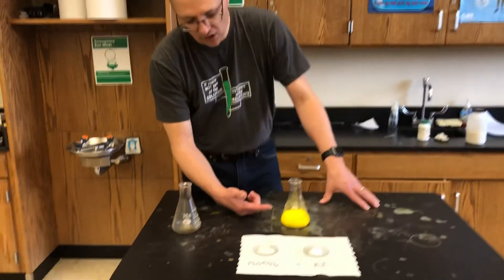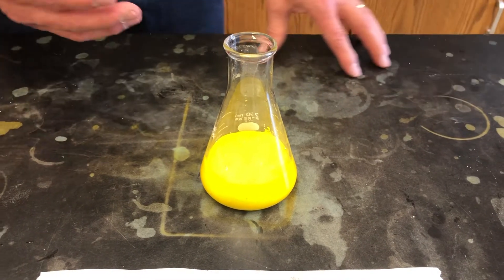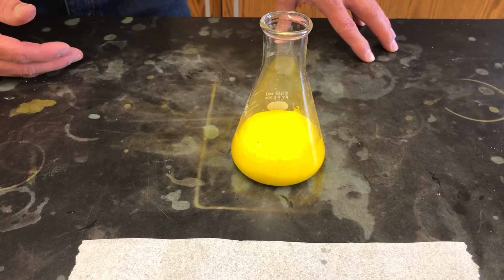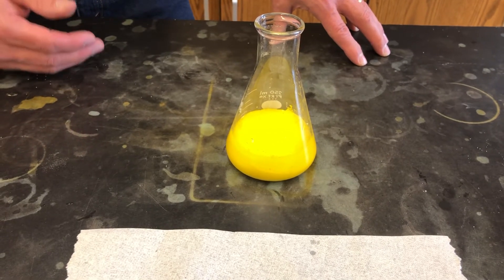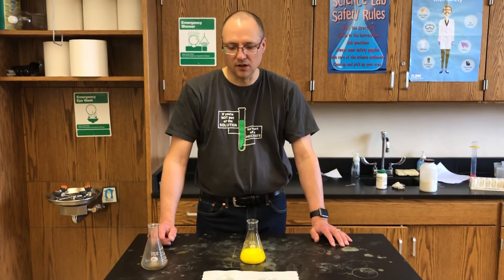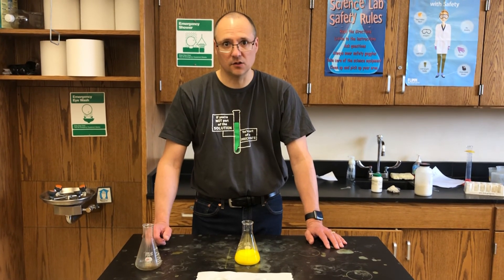As we look at this Erlenmeyer flask — and I'm going to come back with another video in just a few minutes after this has time to settle — this actually produced not a yellow liquid but a yellow solid. That is the new solid that was produced: the product, which is lead iodide, PbI₂. And then we'll have a clear liquid in there which is potassium nitrate, KNO₃, and we'll show you a picture of that in just a little bit.